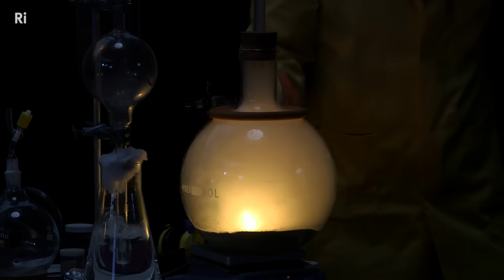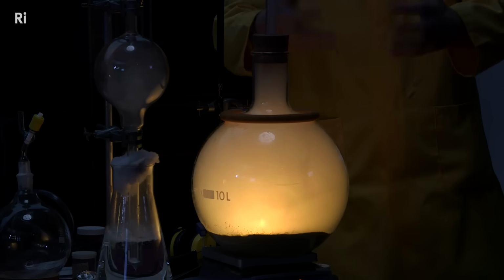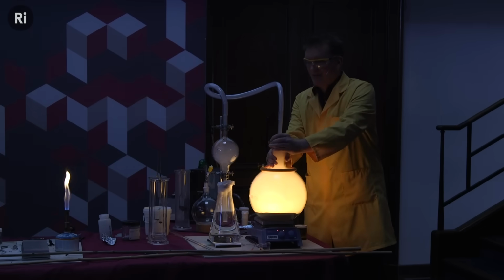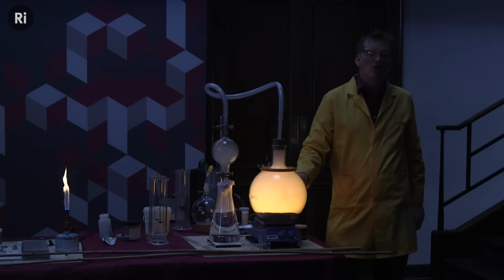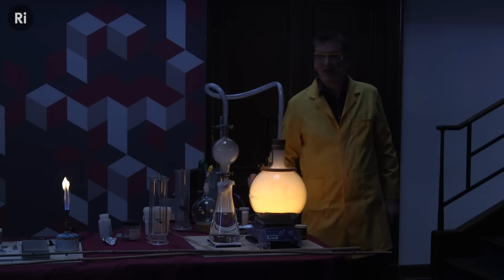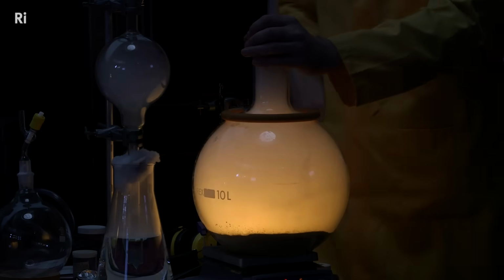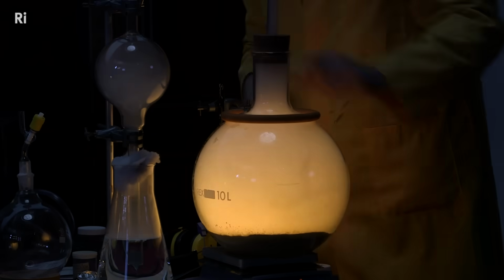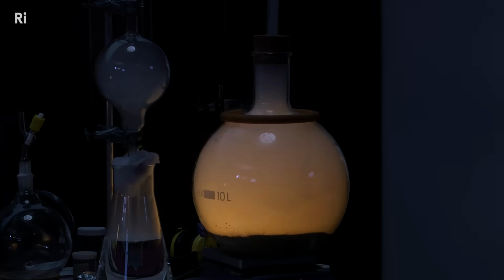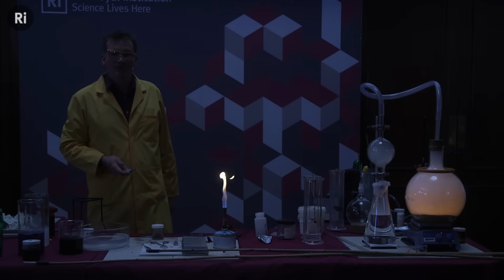and it's burst into flames, and it's giving out a fantastic light. In fact, the name phosphorus means the light bringer. It's giving out a lot of lovely light here, so that's how it gets its name. But the smoke, which is being safely absorbed by the apparatus here, is the phosphorus oxides. We can have up to P2O5. It forms phosphoric acid when it reacts with water. So this is making an acid. 2 phosphorus, though, with 5 oxygen. Well, let's keep on going.